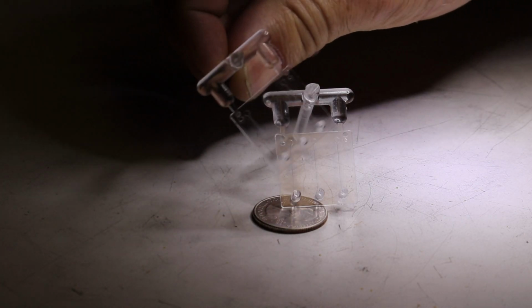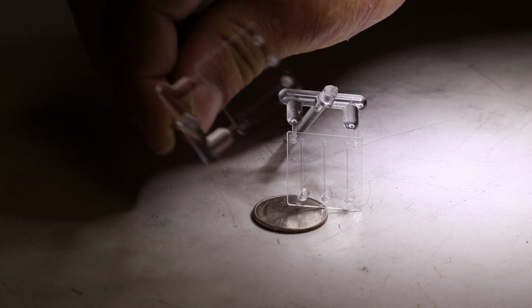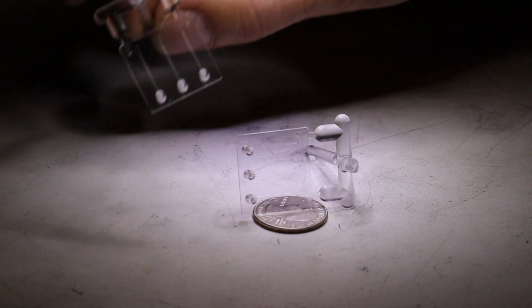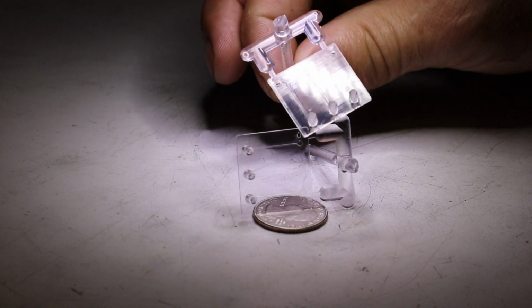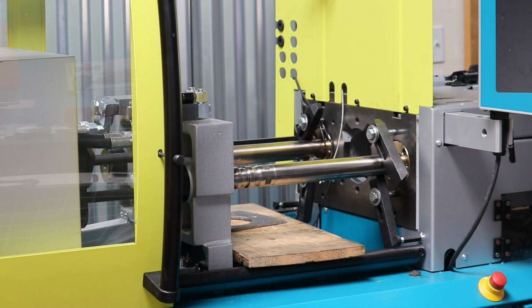So this week we're concluding the Microgroove molding project where we mold the parts shown here. The previous two episodes were making the mold, and this week we're actually going to run the mold in the molding machine. Alright, so now we can load our mold into the molding machine.